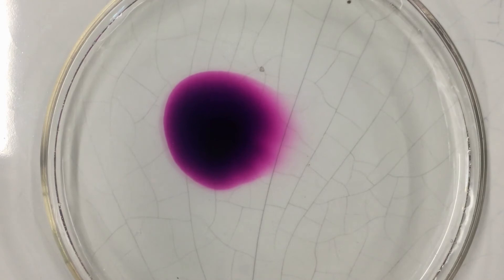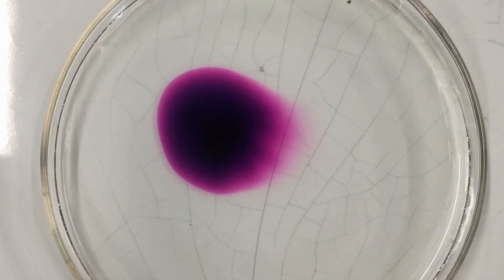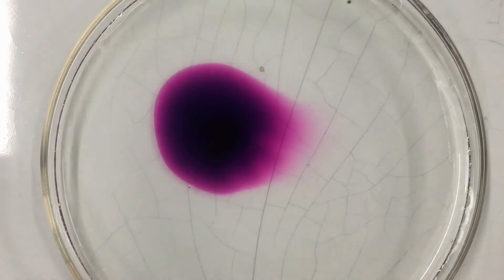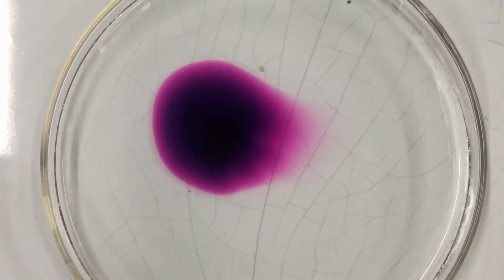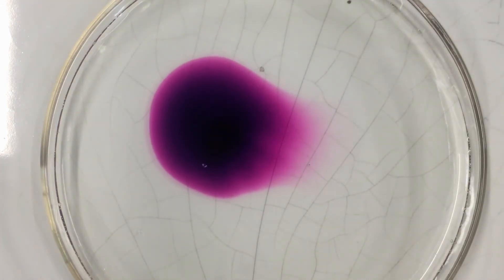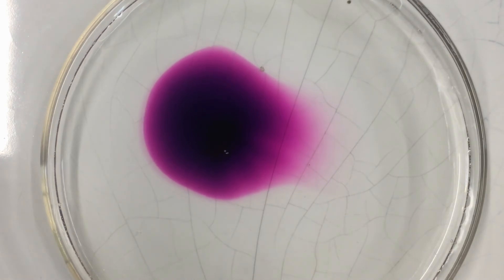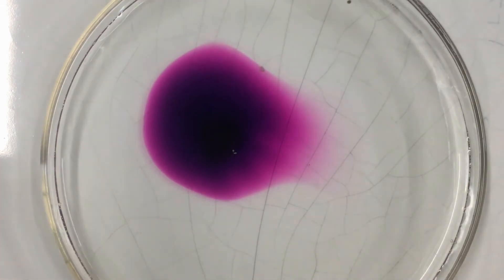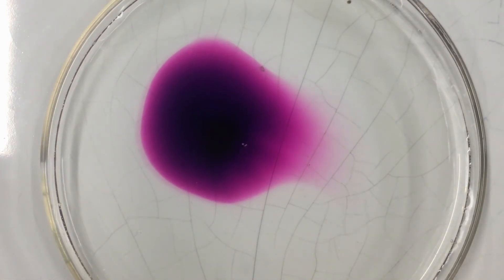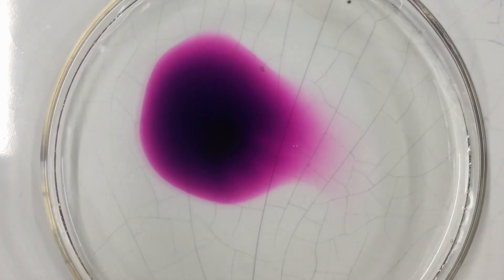We want to observe every step of the process. First, the color of the crystals before we added them to the water — we know that's dark purple. When we add it to the water, it dissolves to form a deep purple color.